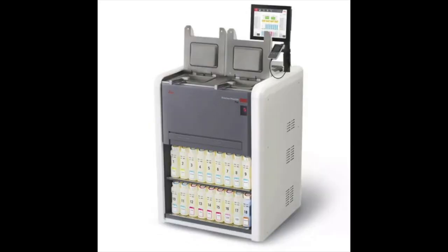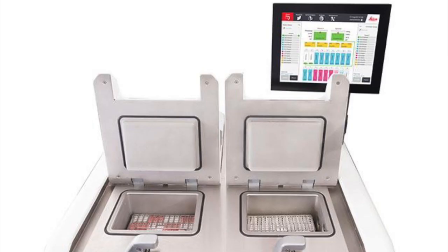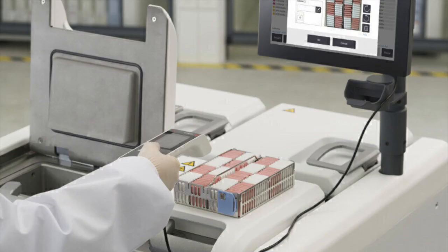It is a fully enclosed processor with two retorts. Each retort operates independently with its own temperature, pressure, and on and off stirrer settings, and it can process up to 200 cassettes. This means that this new processor can run two different protocols and process up to 400 cassettes simultaneously.